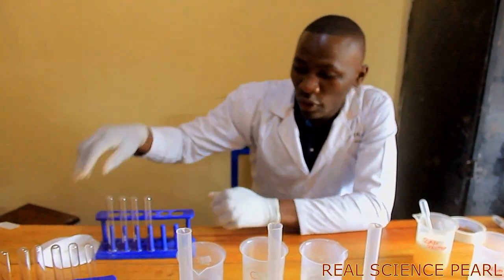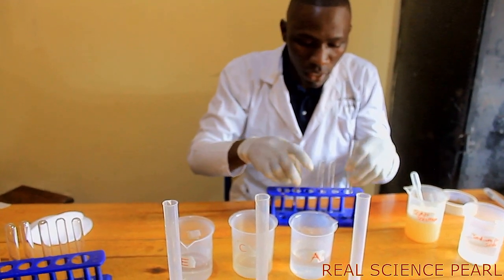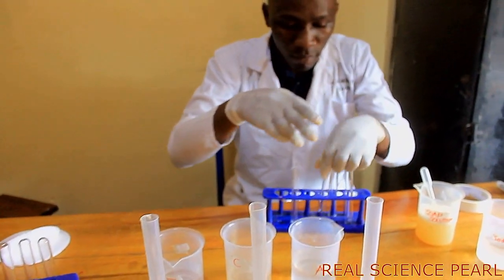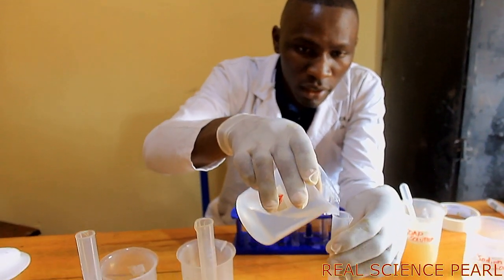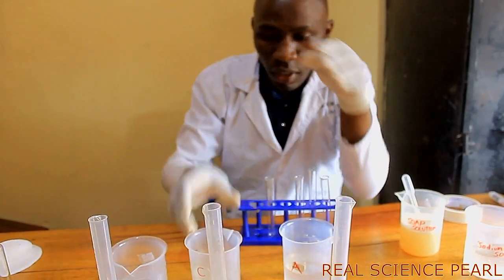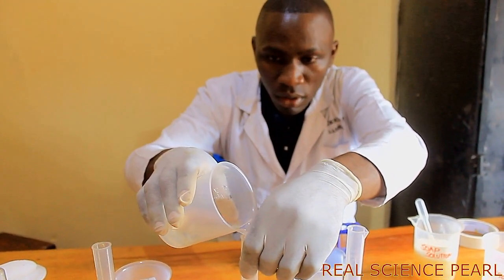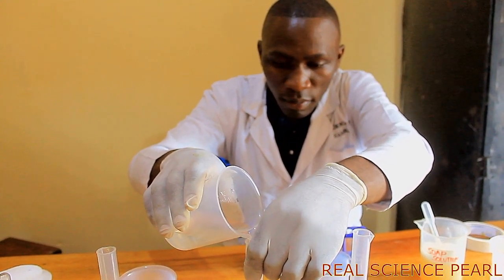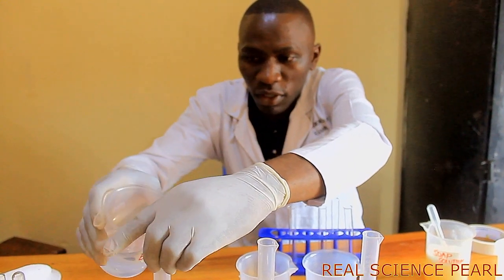So this is A, I measure 3 mils. Then C, I also measure 3 mils. Then E, I also measure 3 mils.